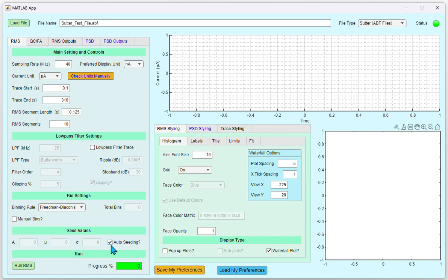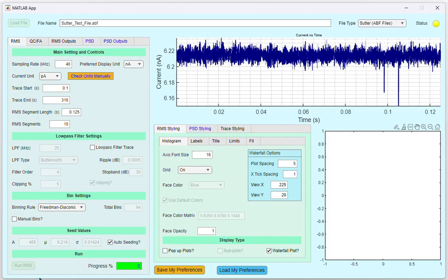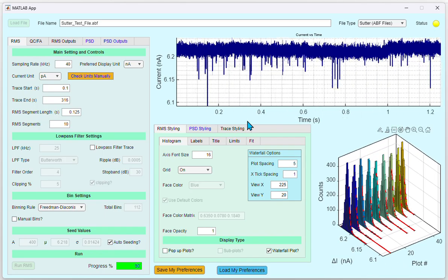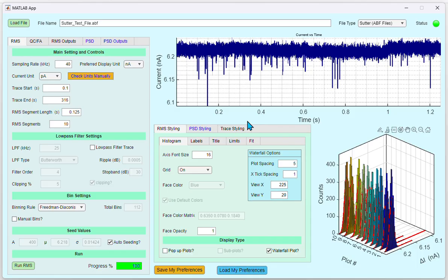Once you're satisfied with all the settings for the RMS, you can click the Run RMS button to compute the RMS. We are using a trace with events in this case. Since there are more baseline points compared to event points, the Gaussian fitting is less affected by the presence of the events. However, for proper RMS calculation, it is recommended to use an event-free trace. You can see the progress under the progress percentage field. We see in real time the current segments that are being used for the analysis, and the histograms and the fits of those segments.